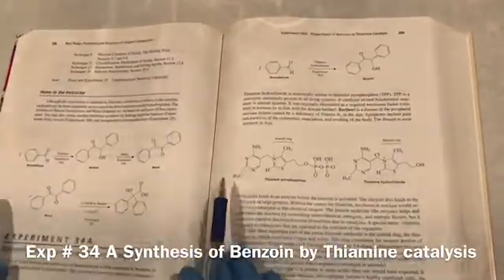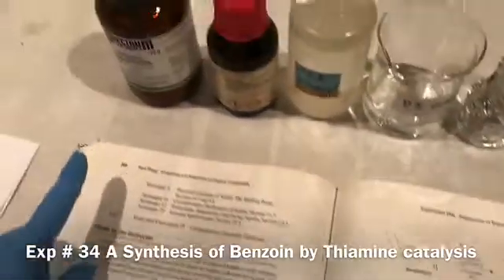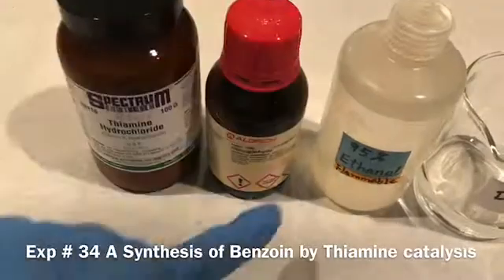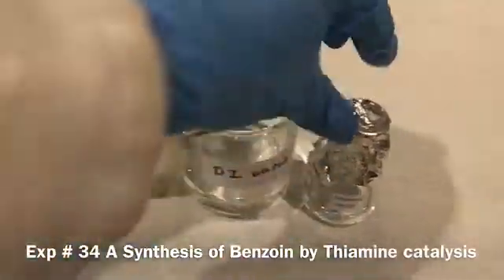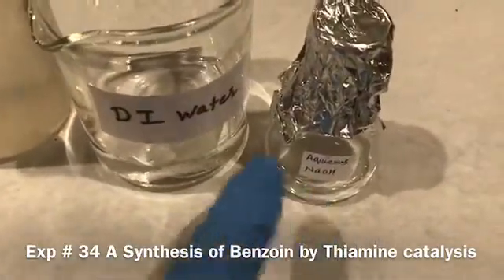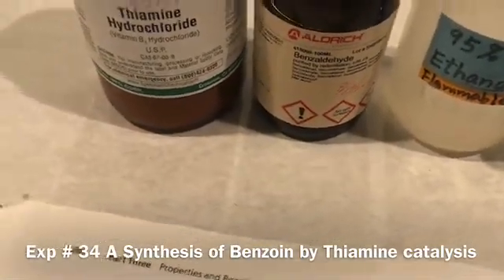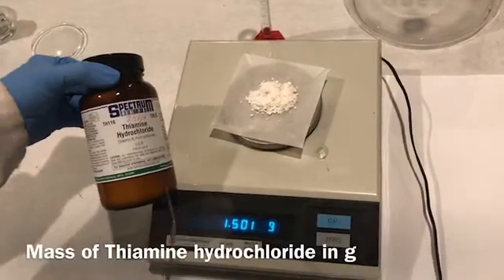Here are the reactants we need for this reaction: thiamine hydrochloride, benzaldehyde, ethanol, DI water, and aqueous sodium hydroxide. I just freshly prepared the aqueous sodium hydroxide and we are going to use all these reactants to synthesize benzoin.